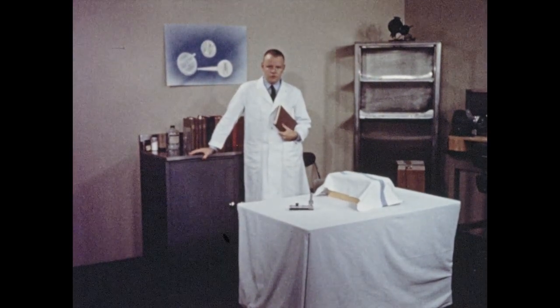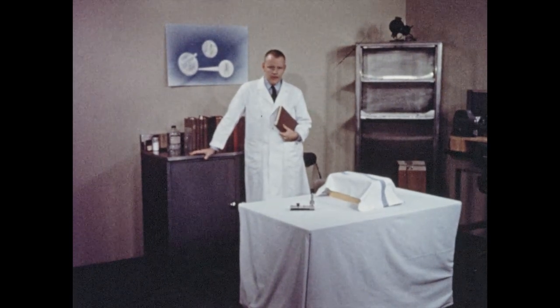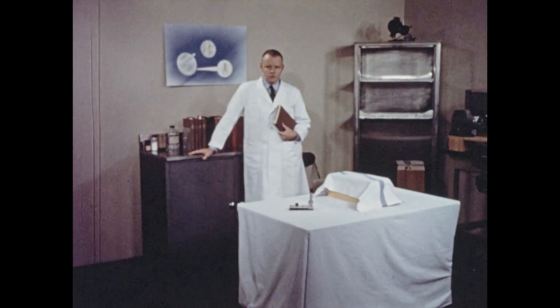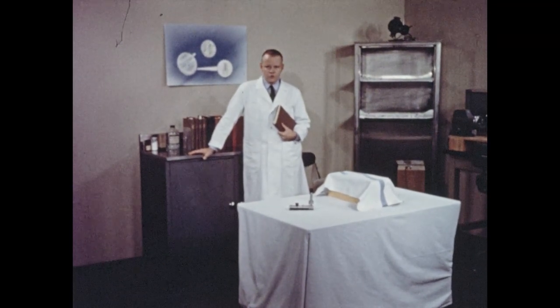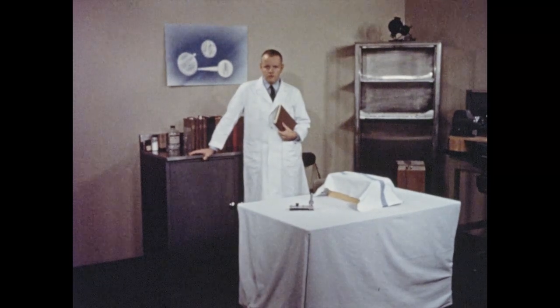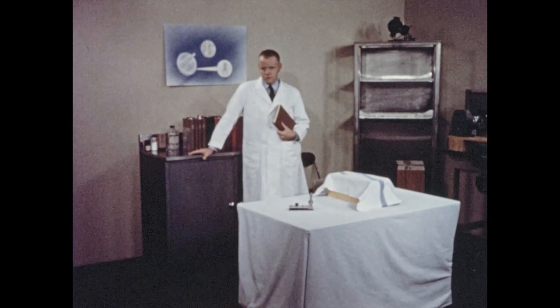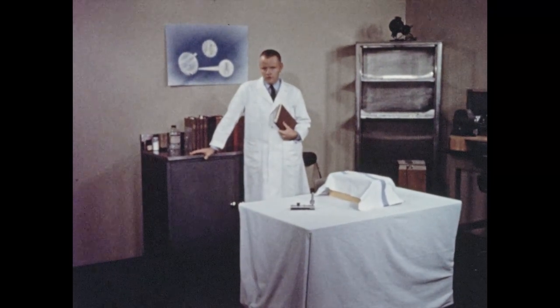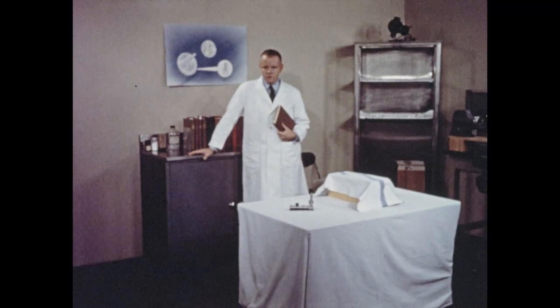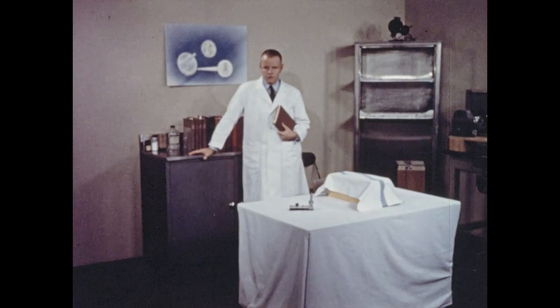We shall demonstrate the rabbit ear chamber, a technique ideally suited for research dealing with the study of blood vessels and cells in a living animal using high resolution, high magnification microscopy.